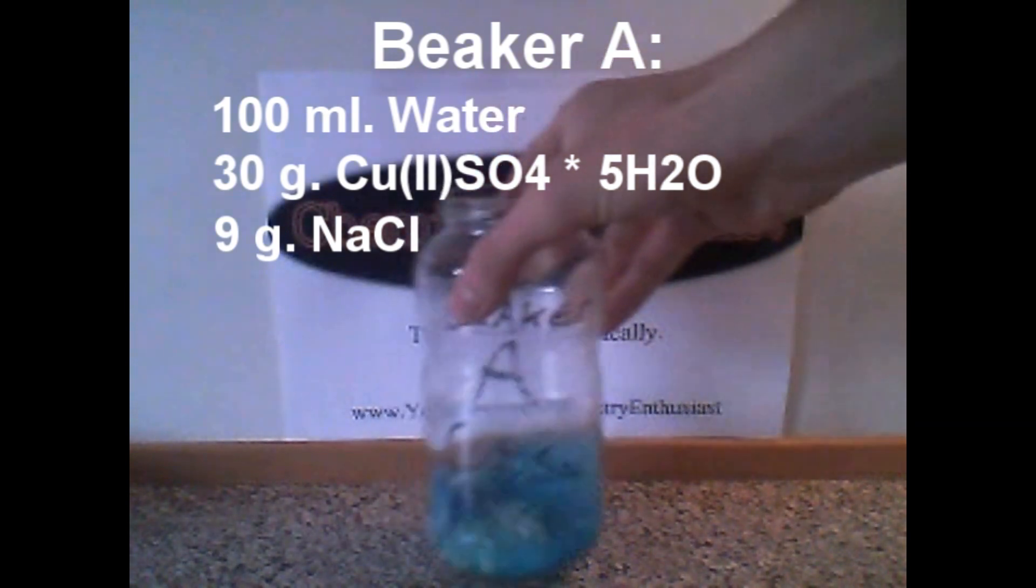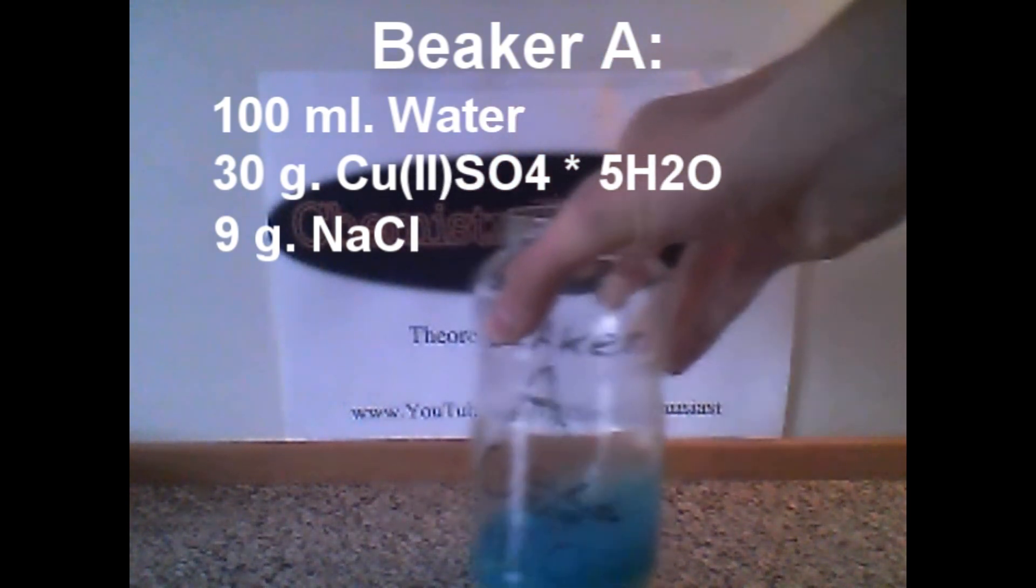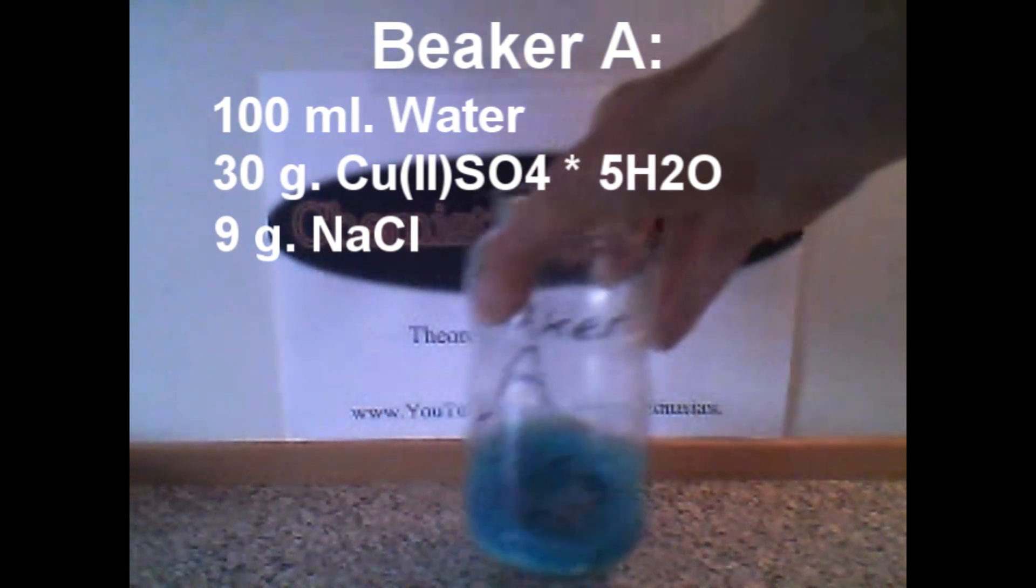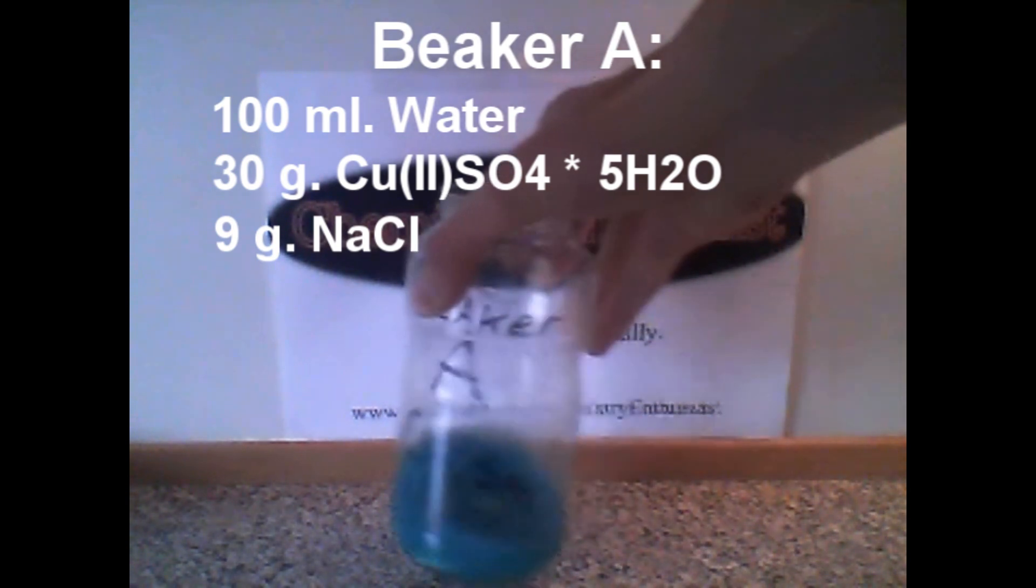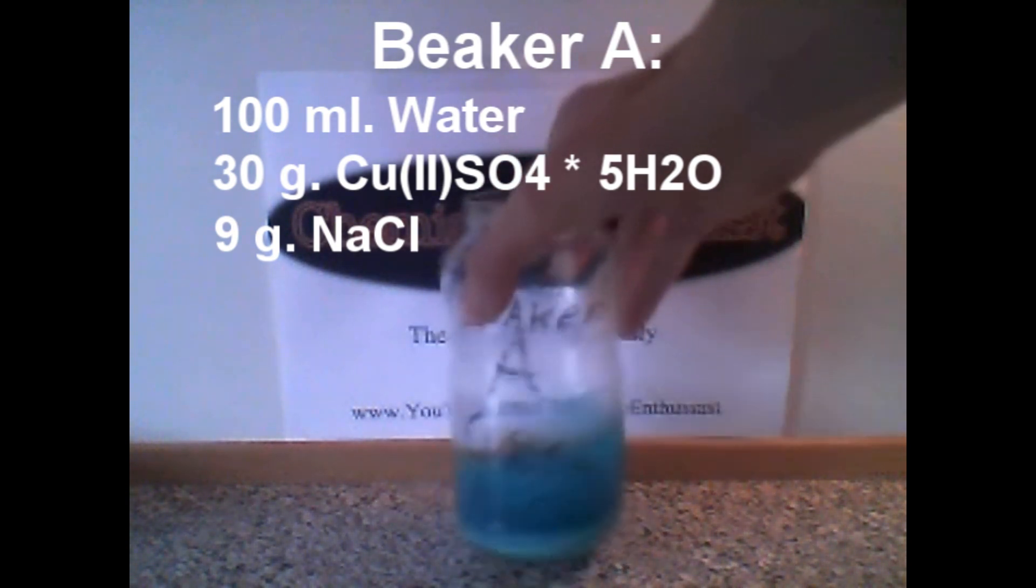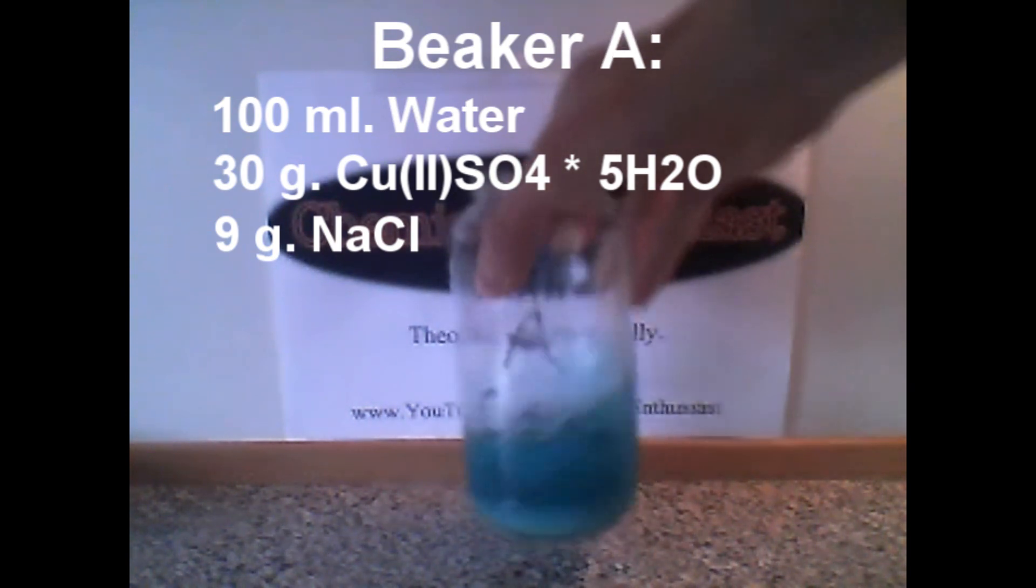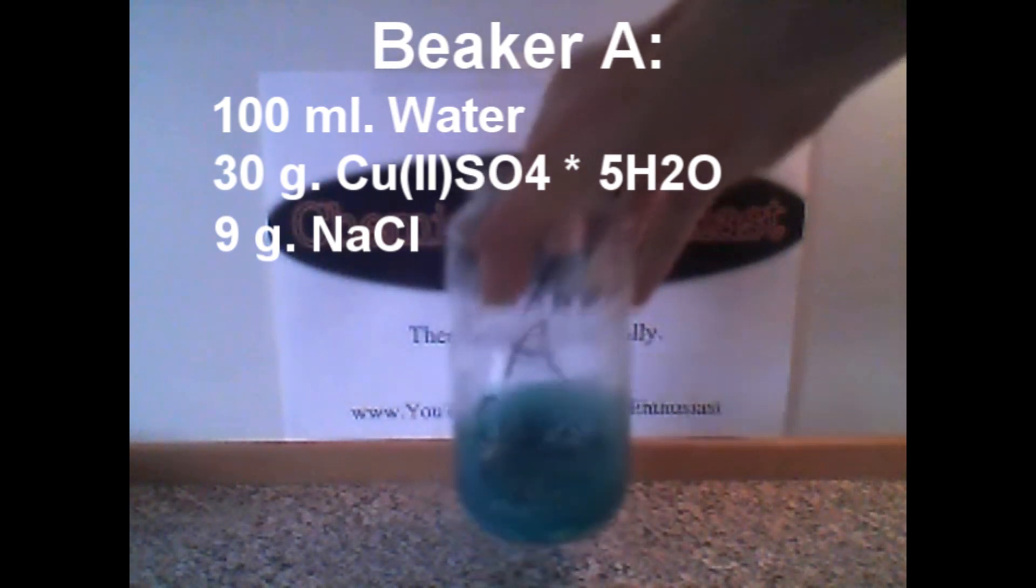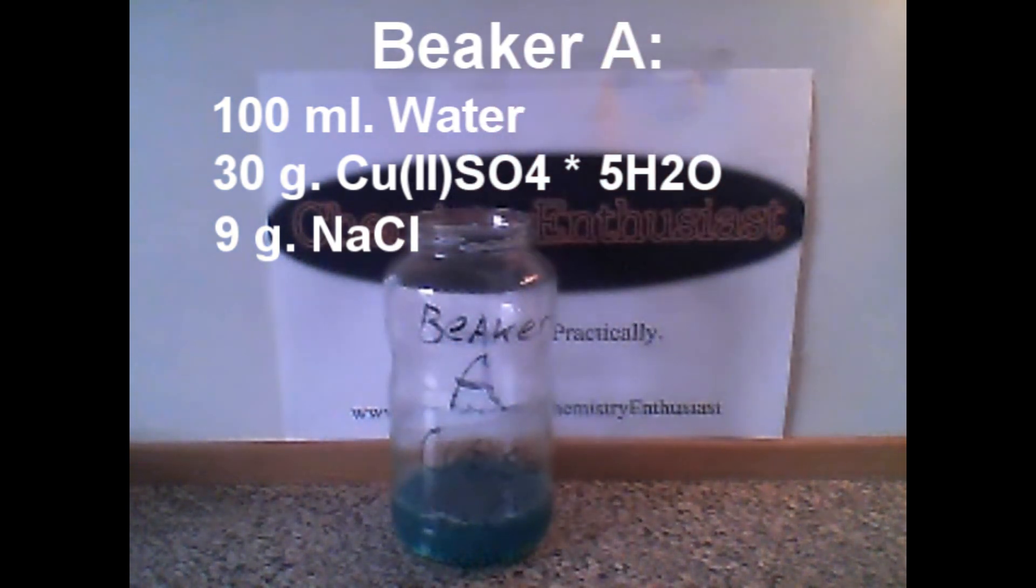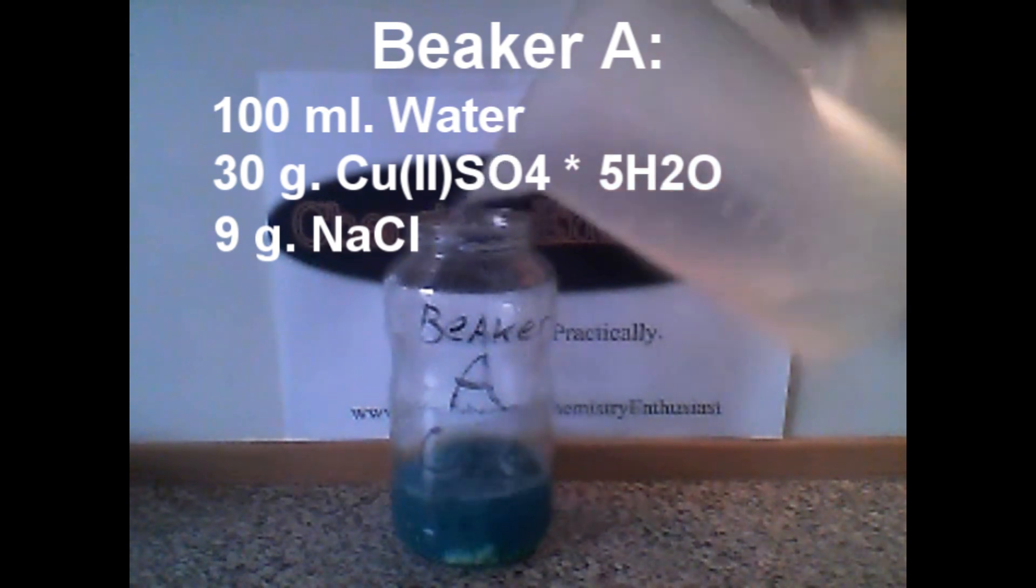This can be quite difficult to dissolve, but you can add some excess water as I am doing in the video. The amount of water doesn't affect the final product. As you can see, I am trying to dissolve it but it is quite difficult, so I will get some water. This should be enough.